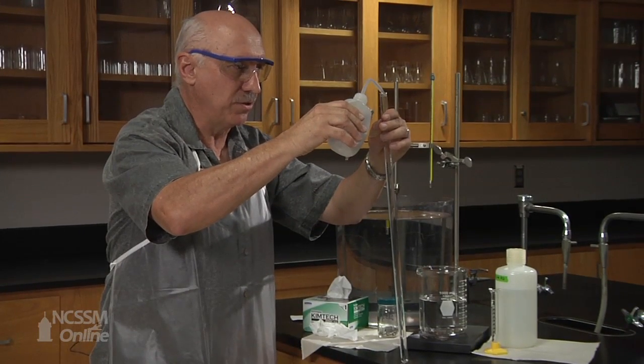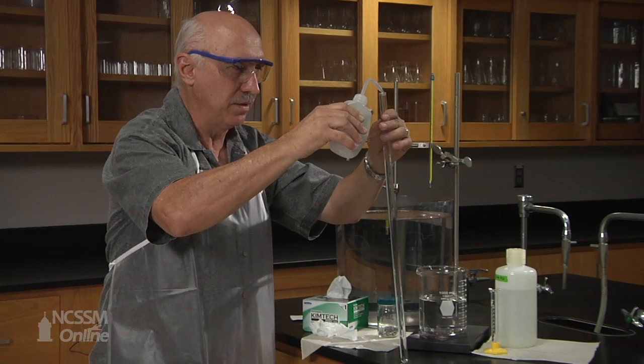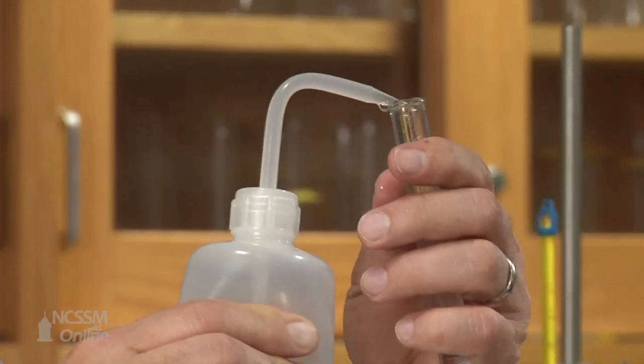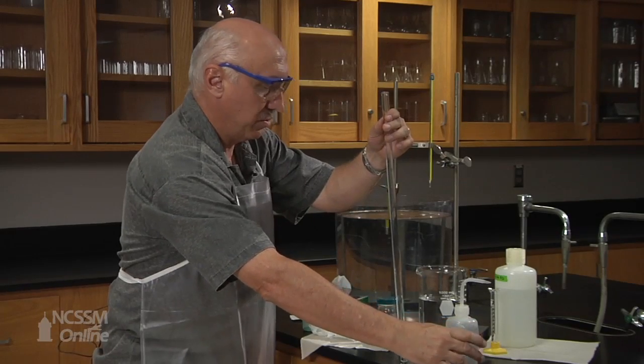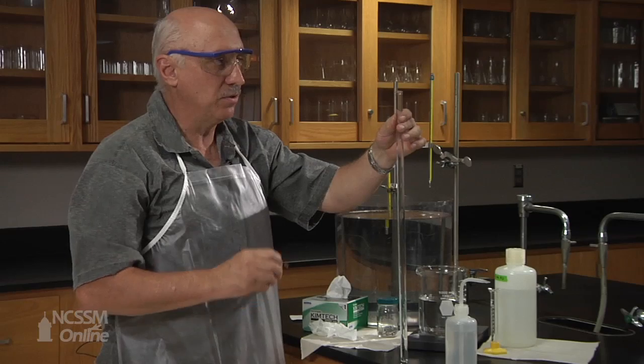Now we have to make sure that there is no air trapped in the tube, so we put plenty of distilled water in the tube.